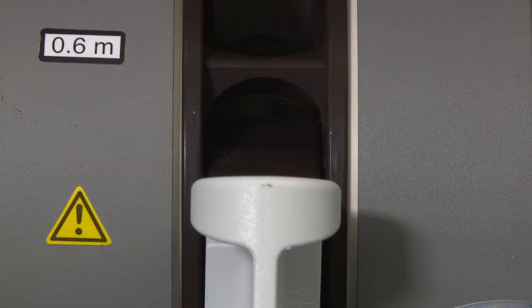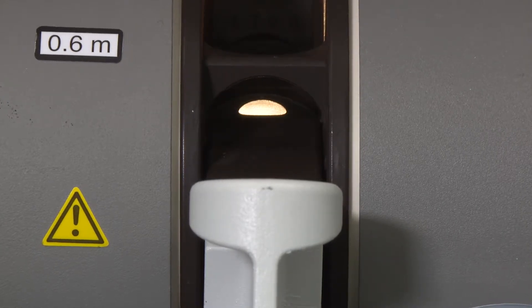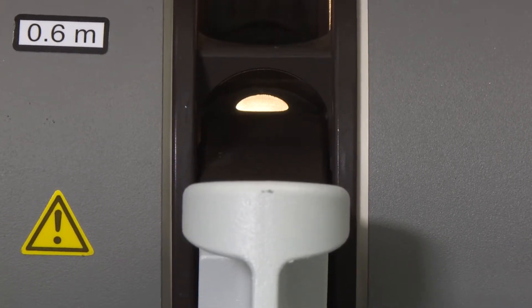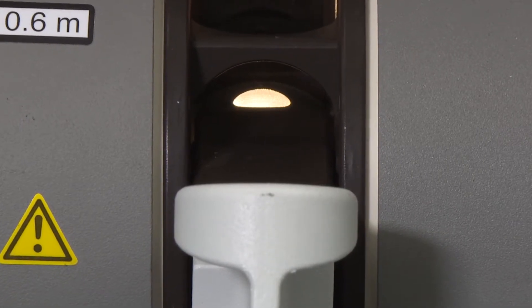Once the contact surfaces and contacts are clean, you can now clean the graphite tube by heating the tube to remove contamination. To do this, heat the graphite tube manually at 2500 degrees Celsius for approximately 5 seconds. You may need several cycles to remove the element.